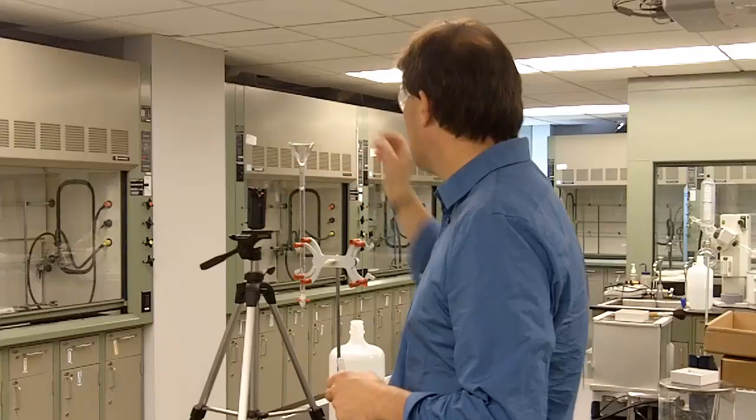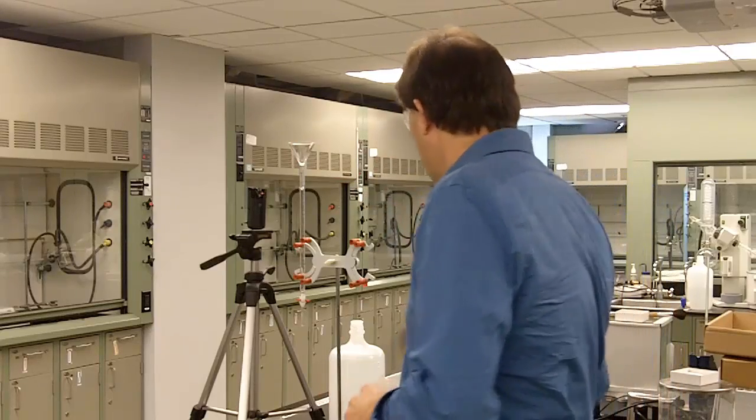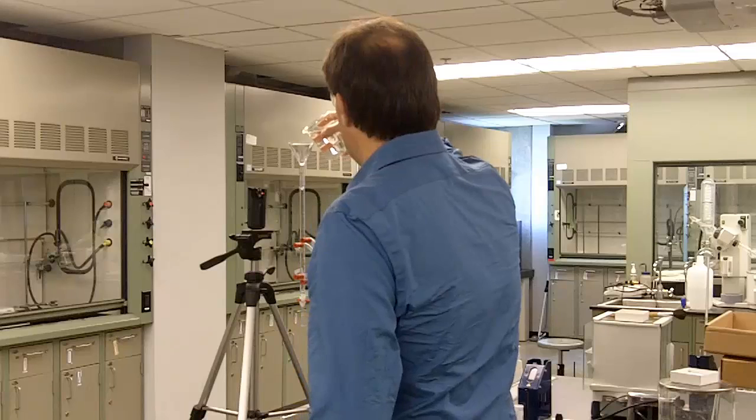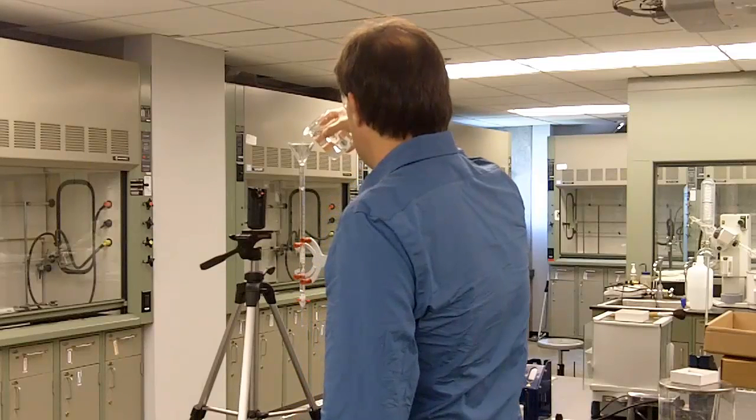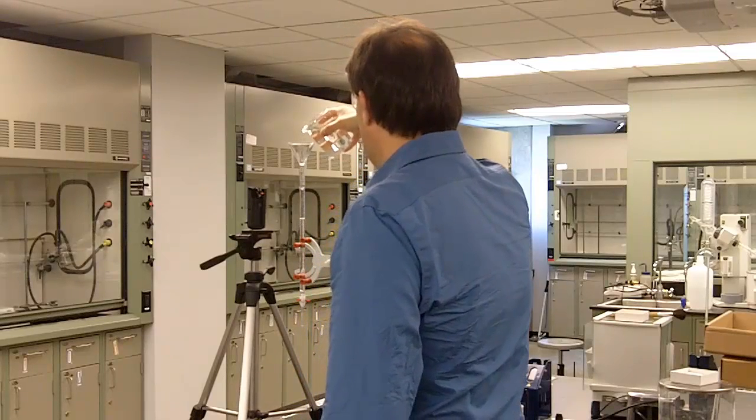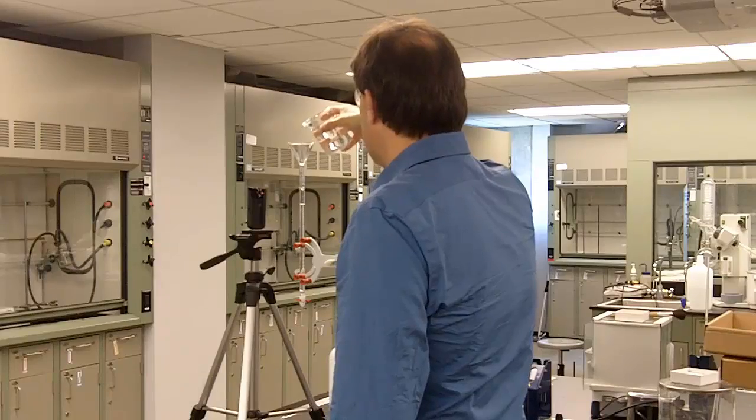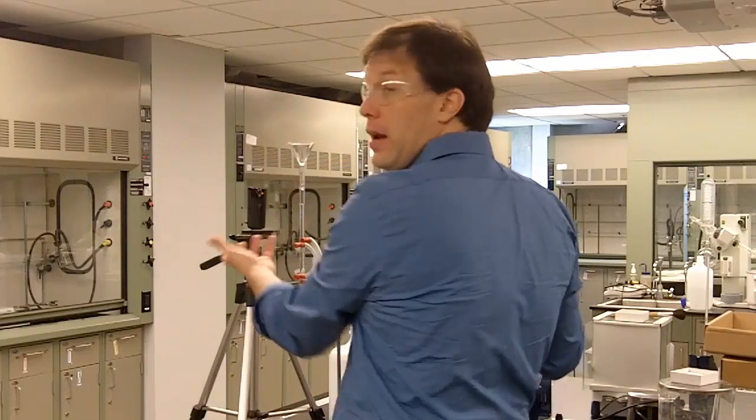So to fill it you are going to take a glass funnel and pour in whatever chemical you want, in this case it is just water. Now don't pour too fast otherwise it will fill up and run out the sides.